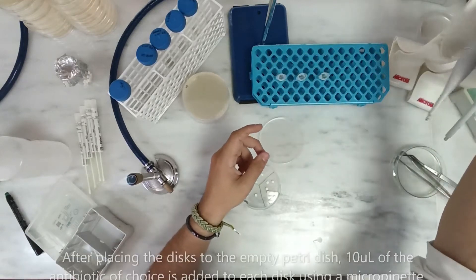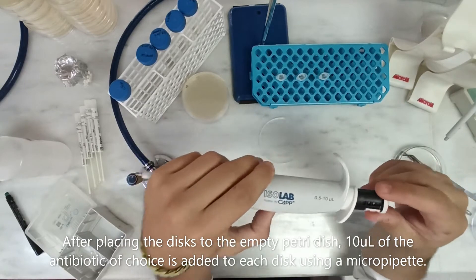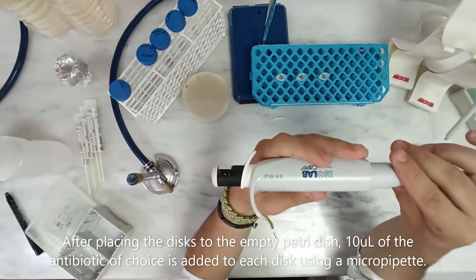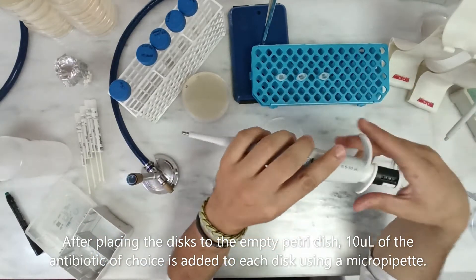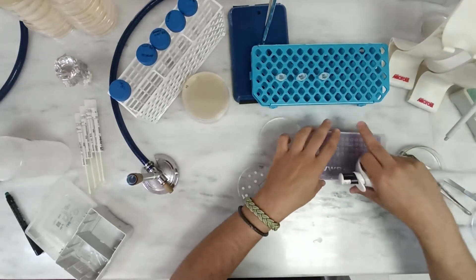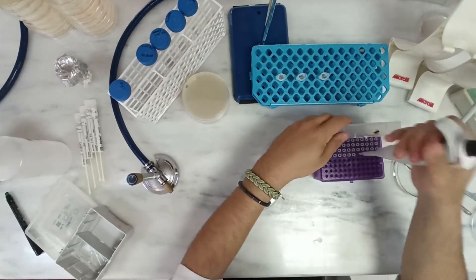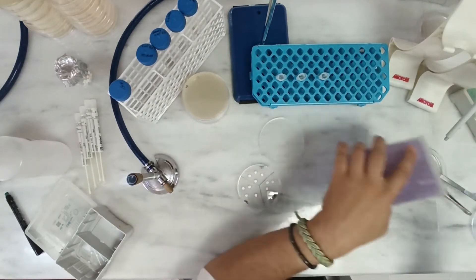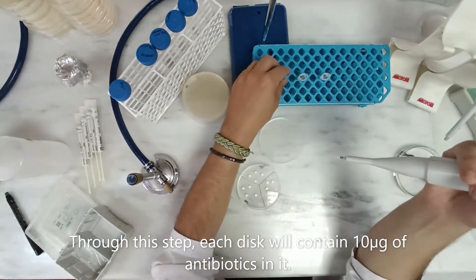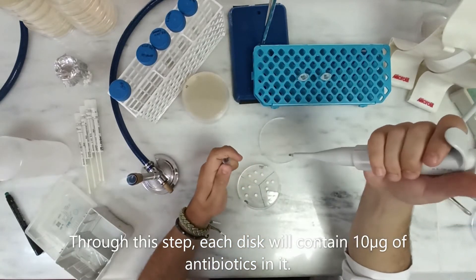After placing the discs in the empty Petri dish, 10 microliters of the antibiotic of choice is added to each disc using a micropipette. Through this step, each disc will contain 10 micrograms of antibiotic in it.